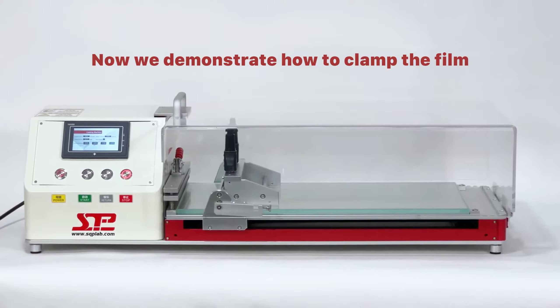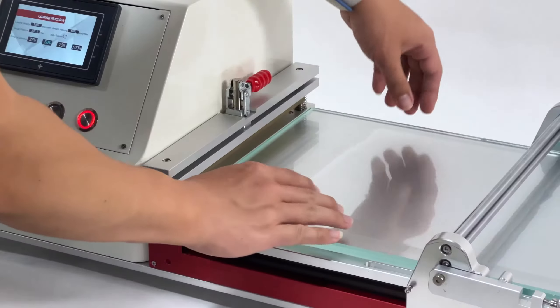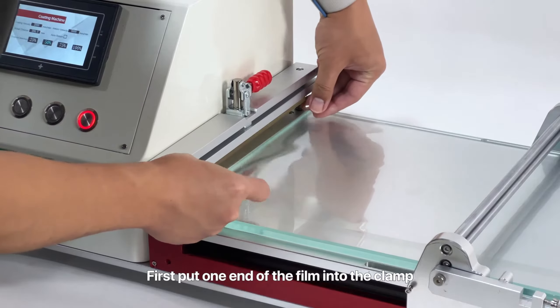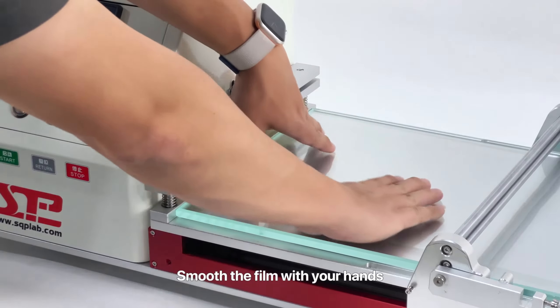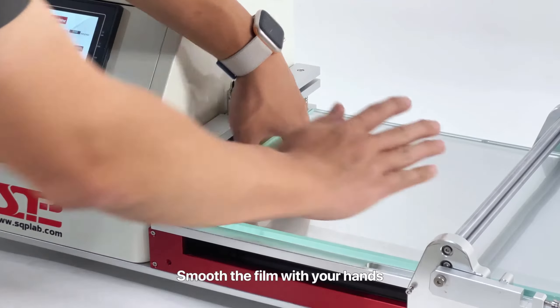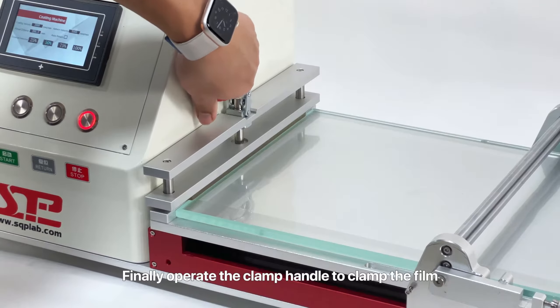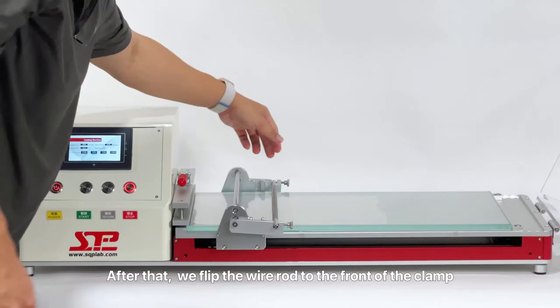Now we demonstrate how to clamp the film. First, put one end of the film into the clamp. Smooth the film with your hands. Finally, operate the clamping handle to clamp the film.